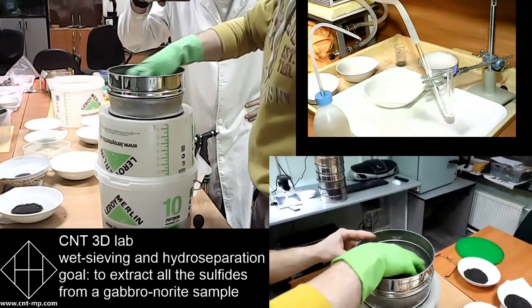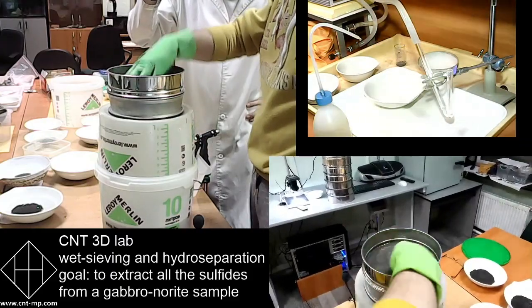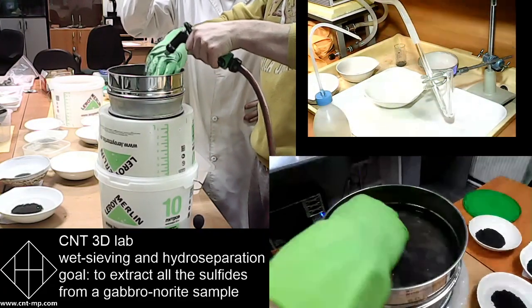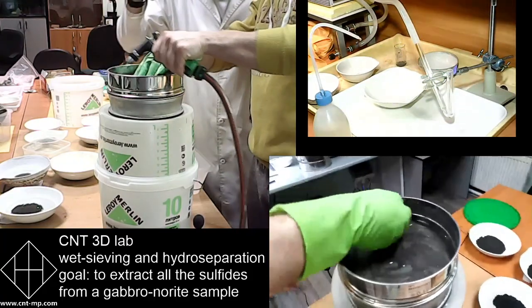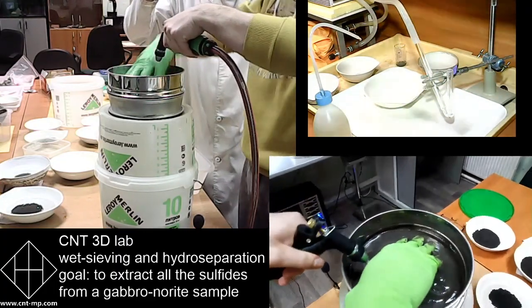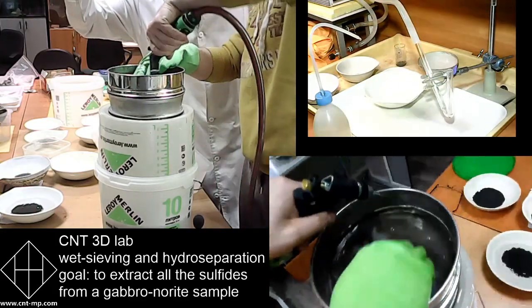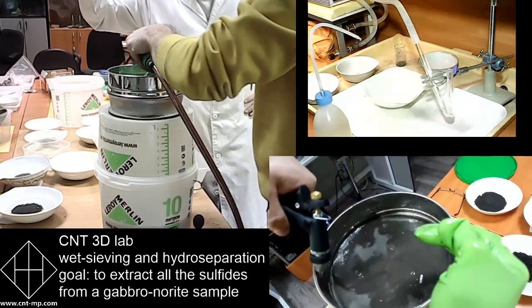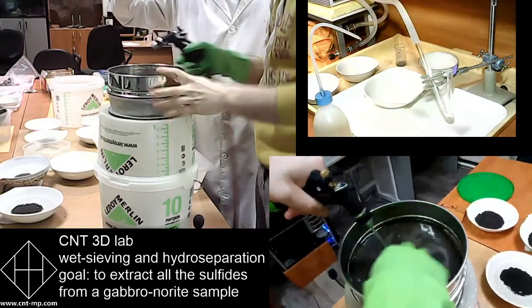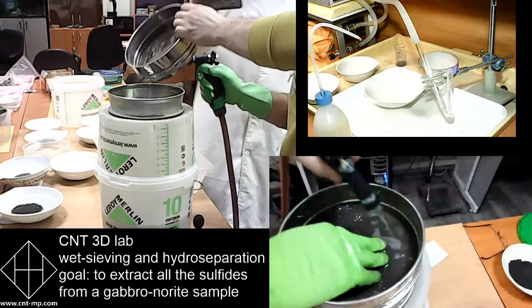Slowly rubbing another size fraction through the sieve. Pretty much the same treatment all the time.